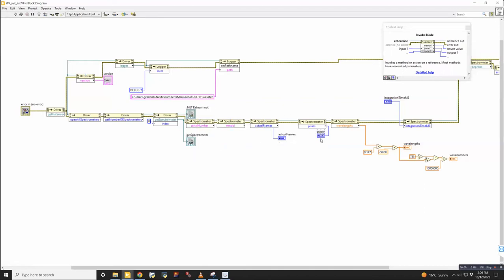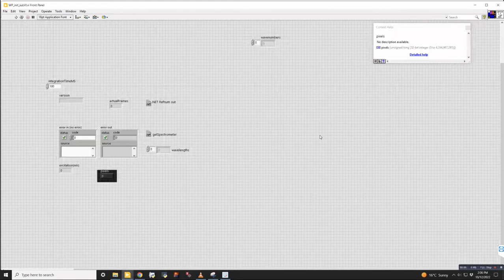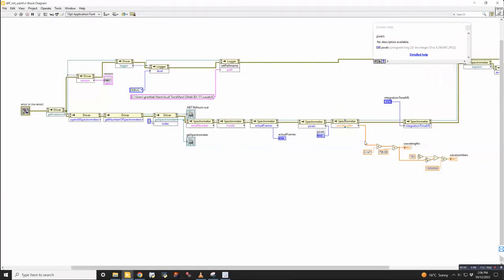Okay, then what we were interested in is this stuff here, right? Yeah. So we wanted to know the pixels. We wanted to know the wavelengths that are coming out of it. And then over here is the conversion using 798.98. Oh, this is the calibration. Yes. So we read these calibration constants out of it. We use that to get the wavelengths, and we use 785 to output the wave numbers.